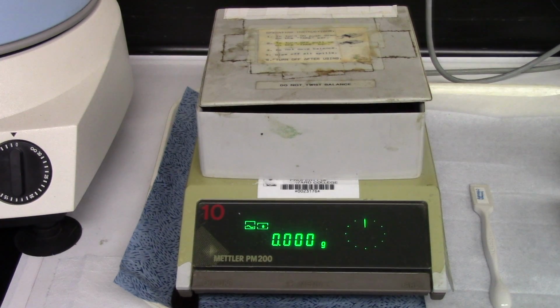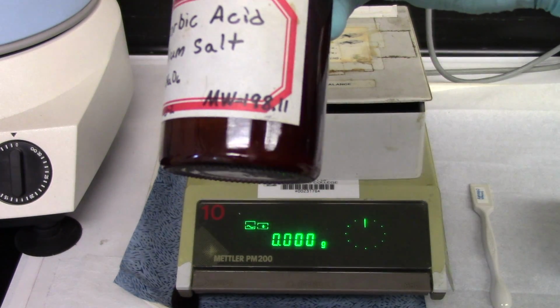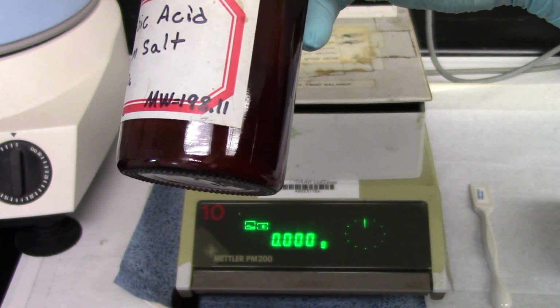Okay, guys, we're going to start with part 2. I think it's 2 of this experiment, the solution concentration. We need to weigh out some stuff here and get it done. So we're going to make a small change from the book. The book says to use vitamin C, and I'm going to use the sodium salt of vitamin C because it just dissolves better. And there's the molar mass. You might want to write that down.